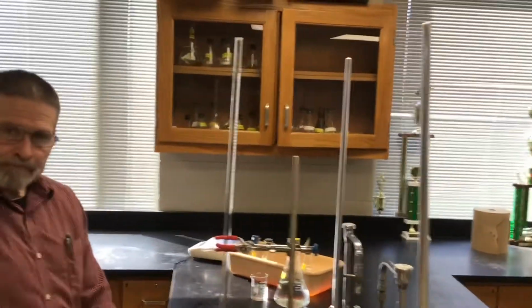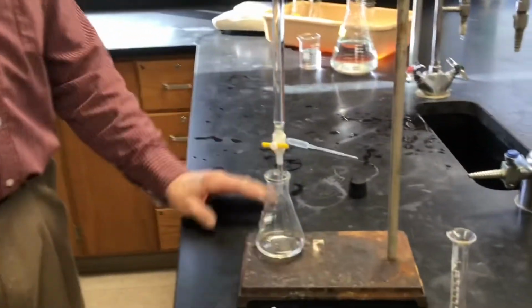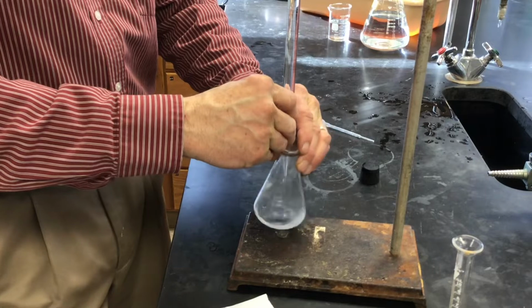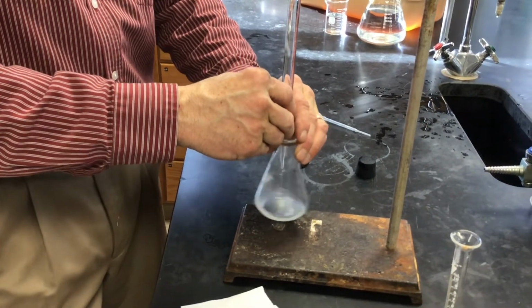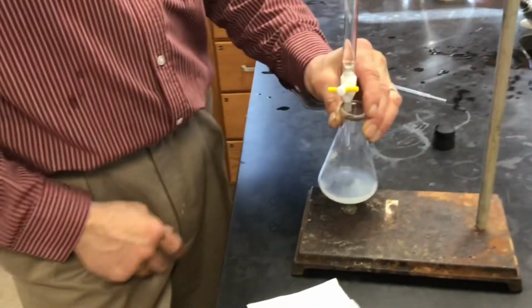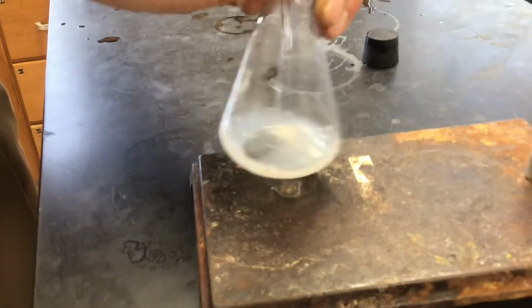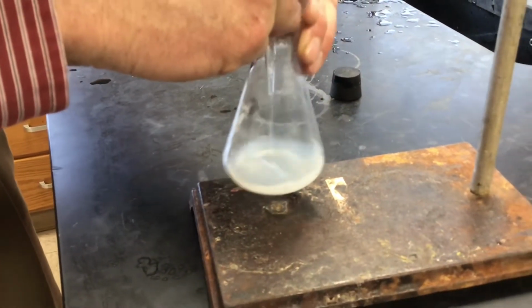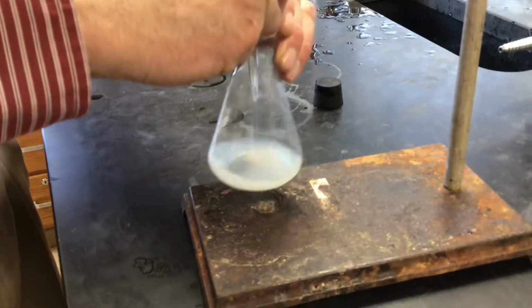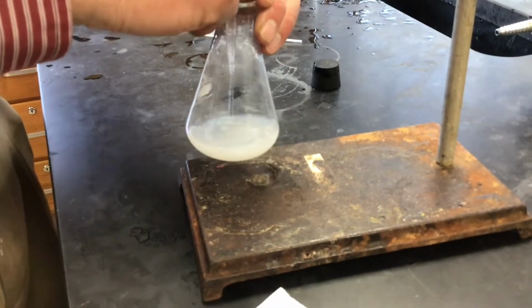We have reloaded the burette. It's at 0.0 milliliters. As we start to titrate, it's going to look white again. You're going to see the white precipitate because of AgSCN. We've already run this thing once, and we've gotten an idea of how much it's going to take. We've got a ballpark idea here. Notice it looks kind of milky white. That's the AgSCN. But when the silver is used up, we're going to start to see some red appear. It'll look kind of like a dingy white color. And let's see where I'm at. I should have to go a ways more.